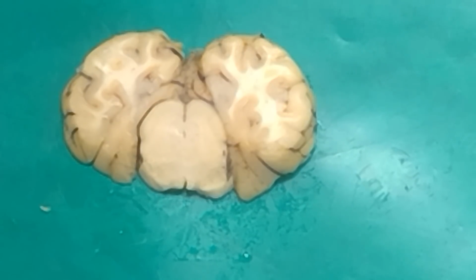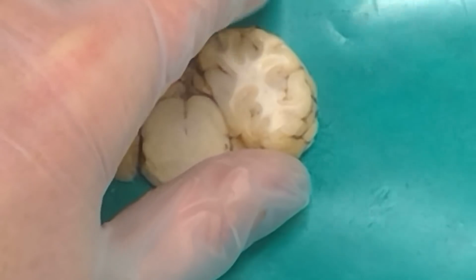Does anyone have any other questions? Where would the anterior commissure be? Anterior commissure, sometimes you can see it in the coronals as being a streak across the cut. I don't see it in any of these. But it'd be like a white line that's going kind of across about the level of the globus pallidus. Okay. Any other questions? Yes.